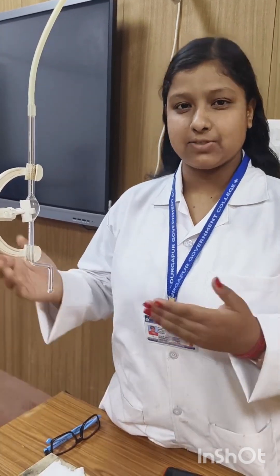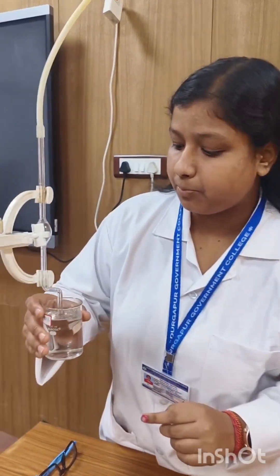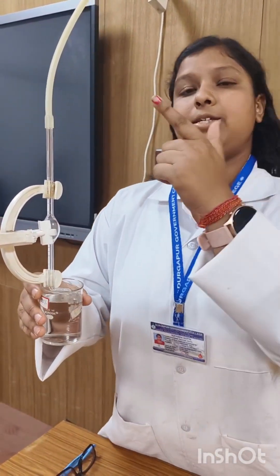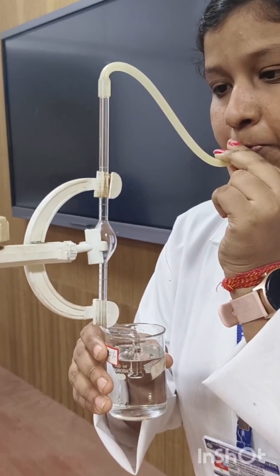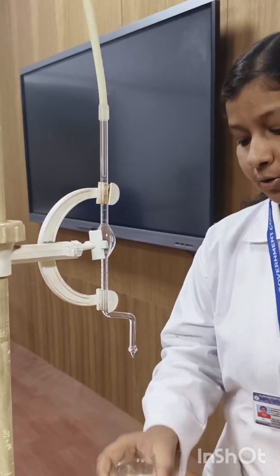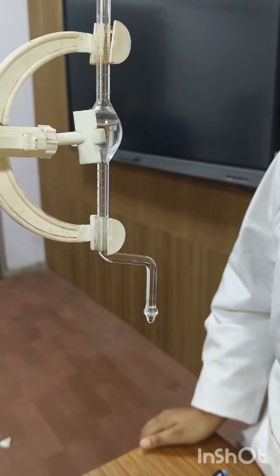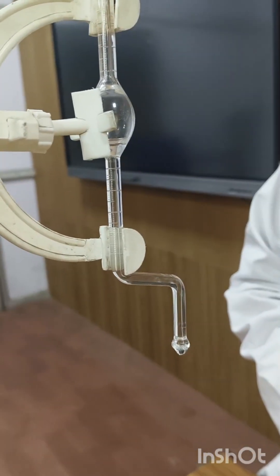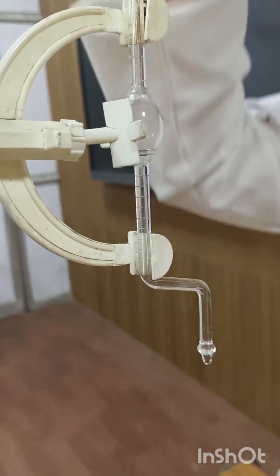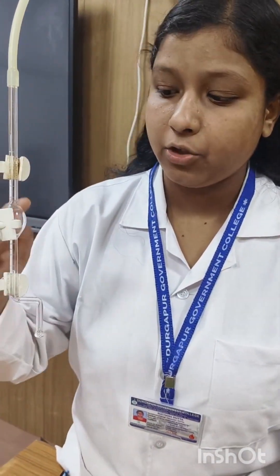Let's take a closer look at how it works. First, we take a beaker filled with 10% methanol solution and place the Stalagmometer like this. Then we suck the solution up through the tube. Now we can calculate the total number of drops falling through the capillary from mark A to mark B.